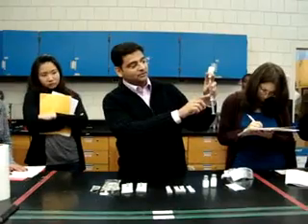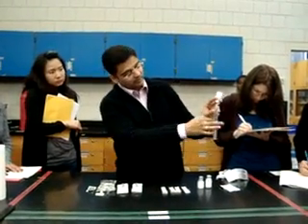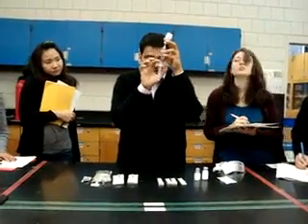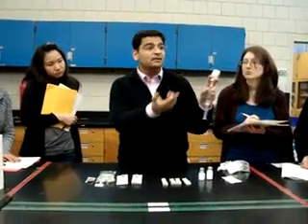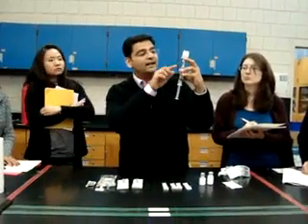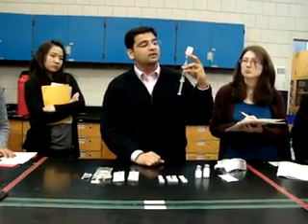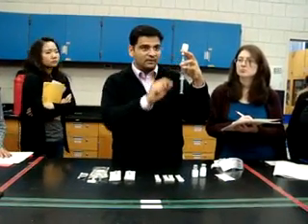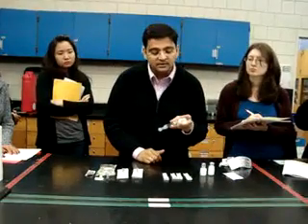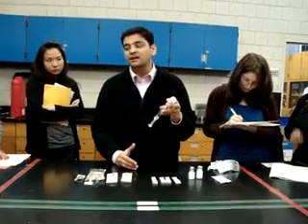See — this bubble moves. One mistake students make is they always concentrate on the bottom looking for bubbles and forget there may be a bubble on the top. I thought there was a tiny bubble, but when I did the test I found a huge bubble at the top. That bubble is there because my needle was above the liquid level, so I just need to push the bottle slightly — you don't have to go all the way back in. While removing bubbles, please hold the needle and the syringe and bottle straight. If you tilt it, air is lighter and the bubble will get stuck and you'll spend 5 minutes unable to get it out. Hold it straight.